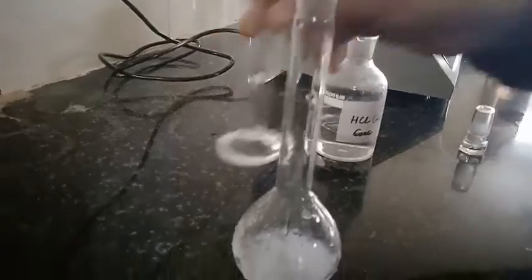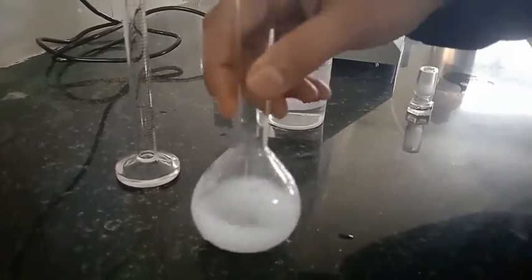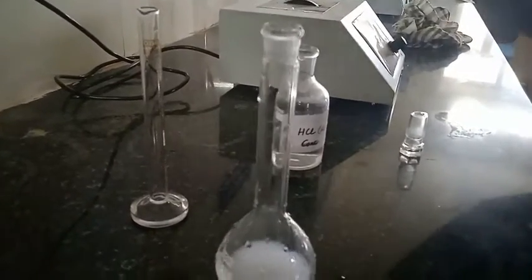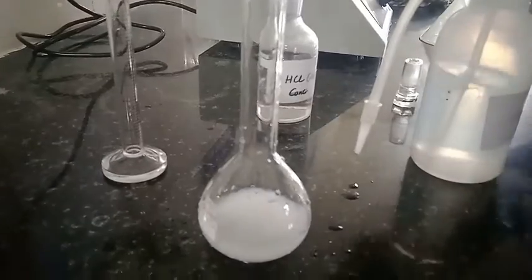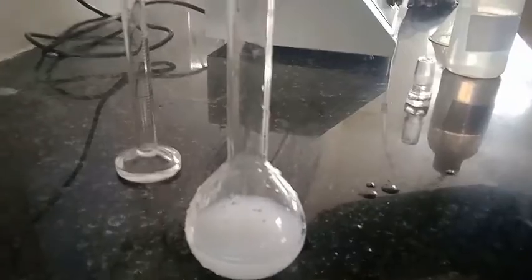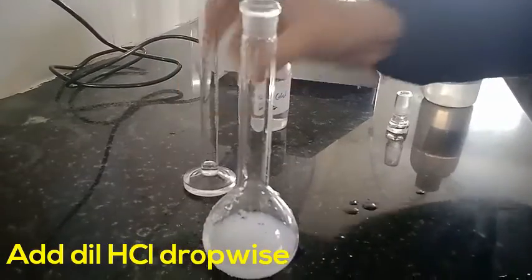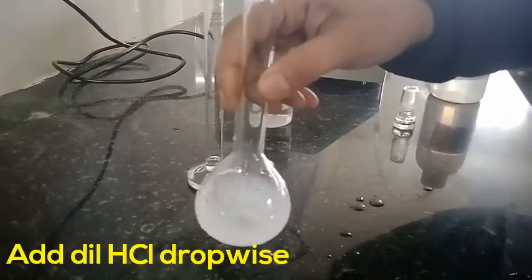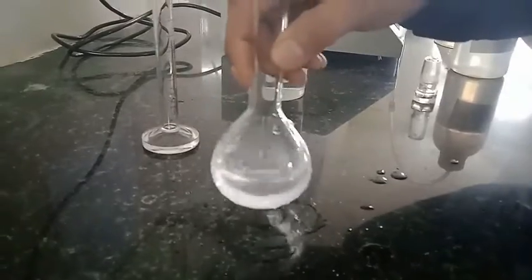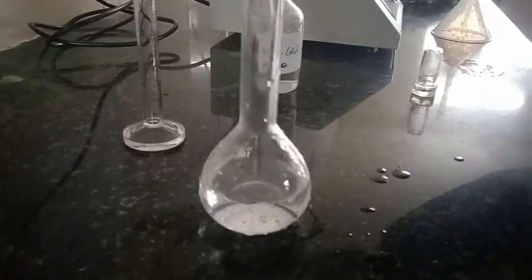Adding the HCl solution — here you can see it is still insoluble. I am adding some distilled water just to check whether it dissolves. Then I add HCl solution dropwise until it is completely dissolved. On further adding of HCl it is now completely soluble.